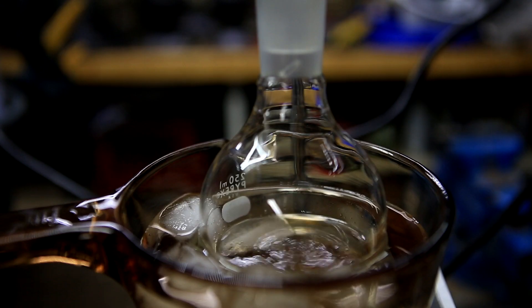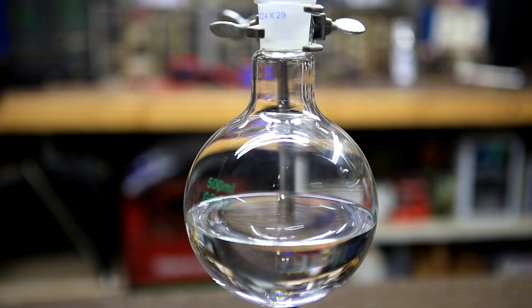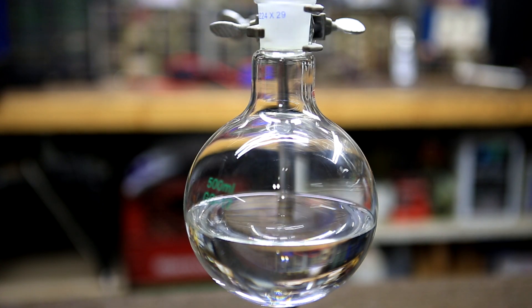Methylene chloride is quite volatile, so I placed the collecting flask in an ice bath to limit solvent loss. I carried out two separate runs and received about 260 ml of methylene chloride in each.